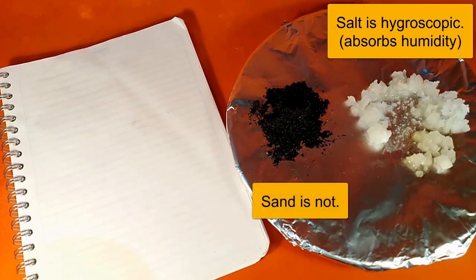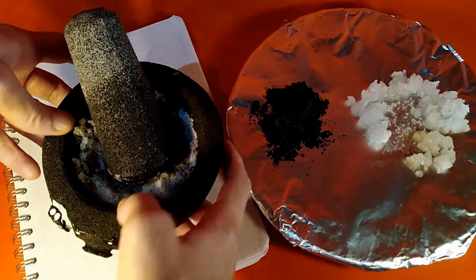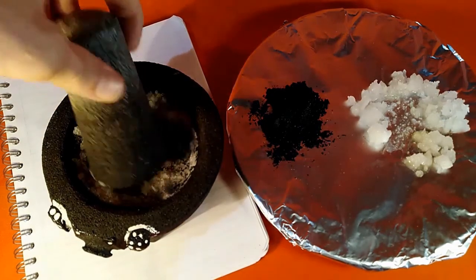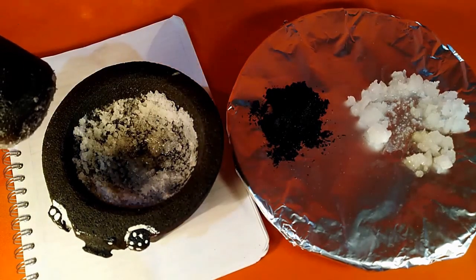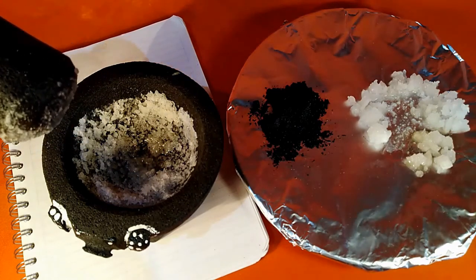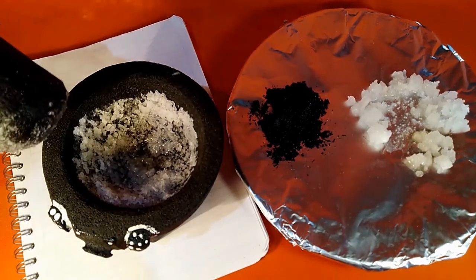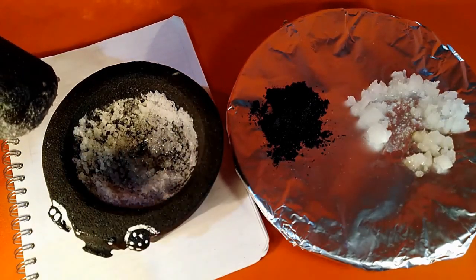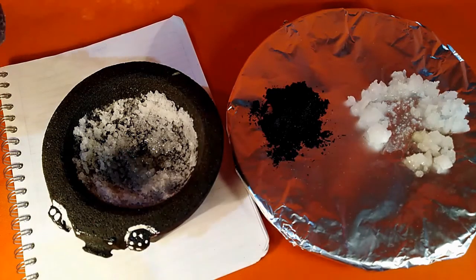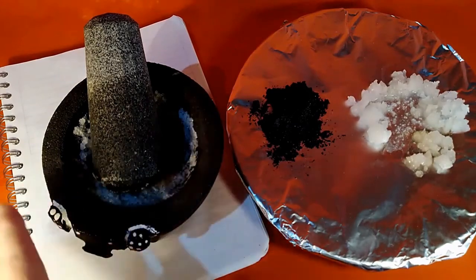Now, the sand is not a hygroscopic material. It remains dry. And as a little further evidence here, you can see this mortar and pestle that I had used to break down the salt. It was in kind of larger rocks of salt. I used the mortar and pestle to break it down before the experiment. You can see some evidence of water down in the bottom. And note here, right, that this salt has absorbed water.